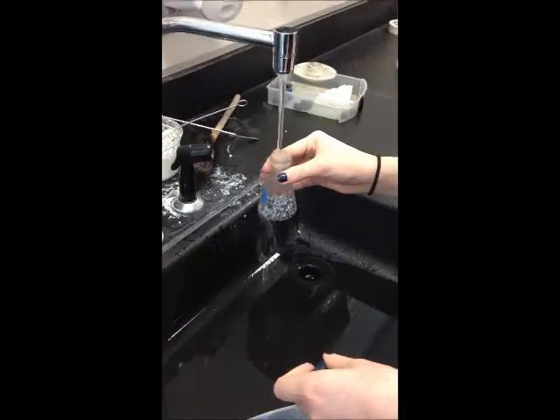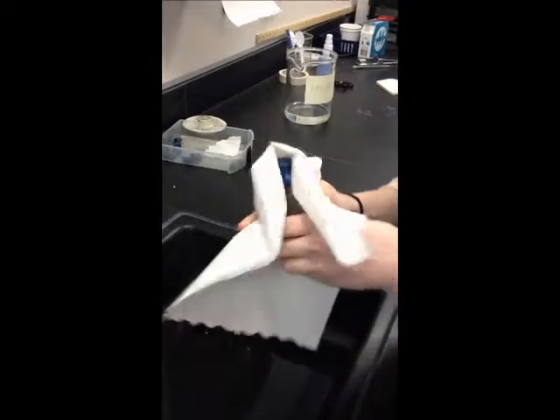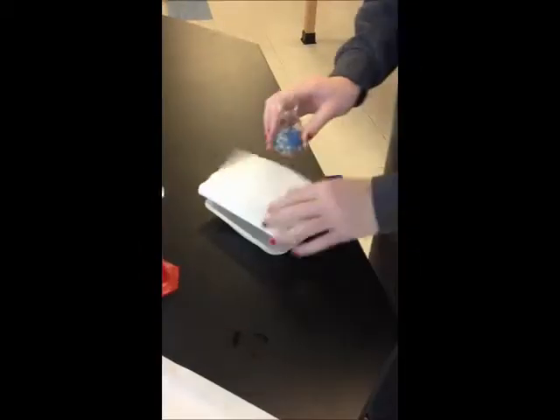Fill the flask with water, insert the stopper, and dry off any excess water. Record its weight, then take the temperature of the water. To clean up, pour the water out into the sink and put the zinc on a paper towel in a weigh boat and leave out to dry.